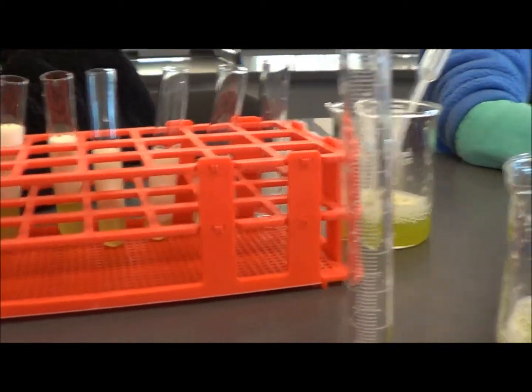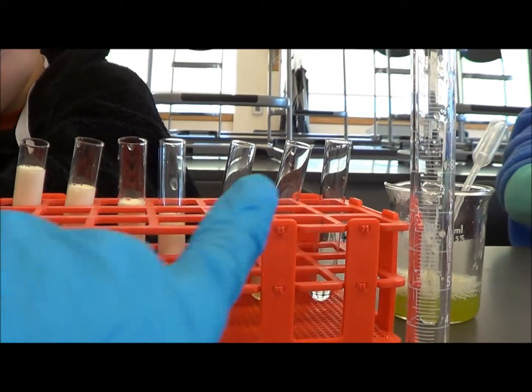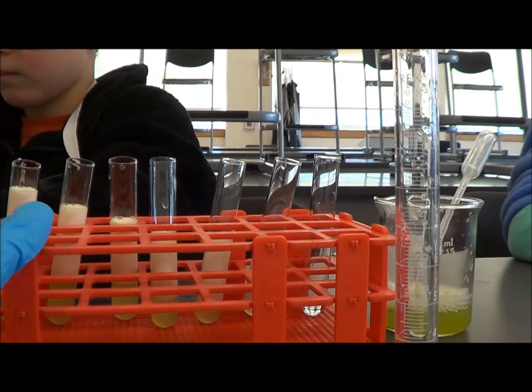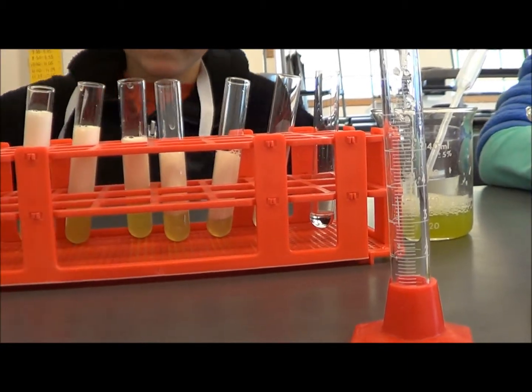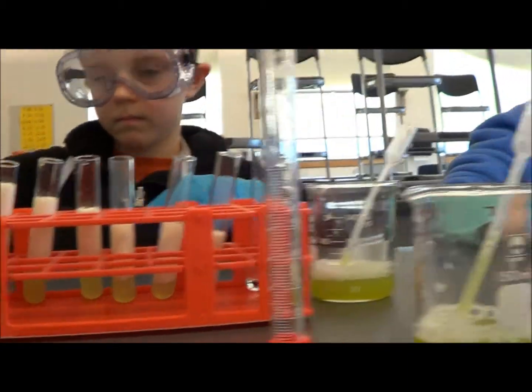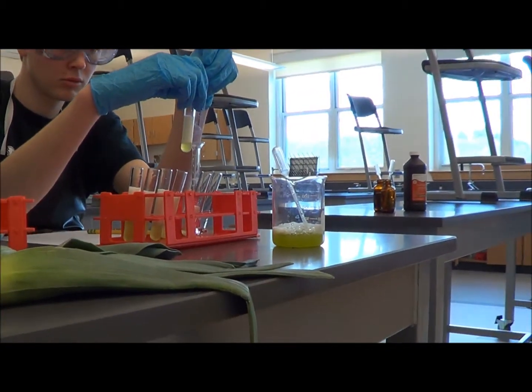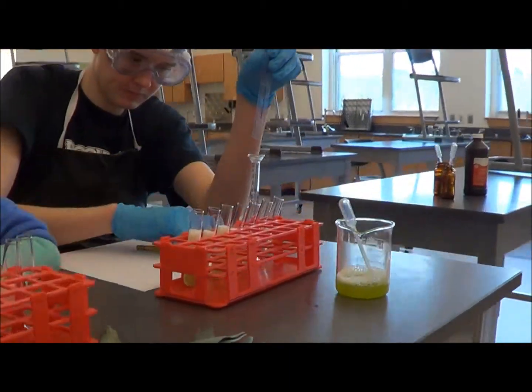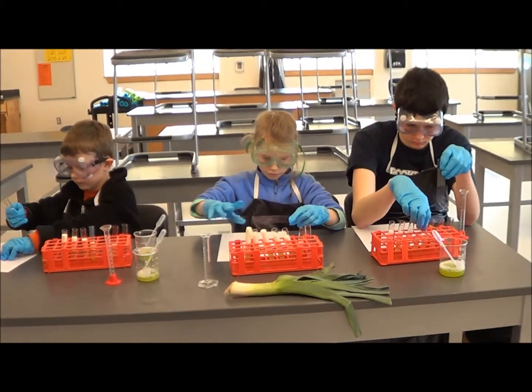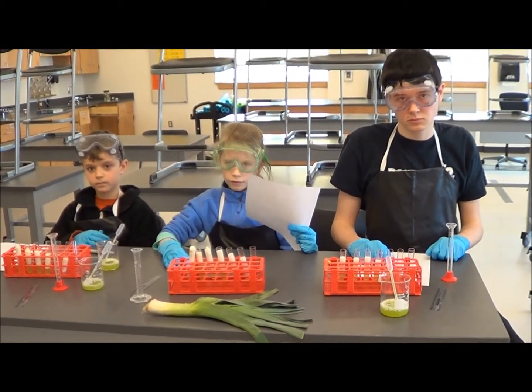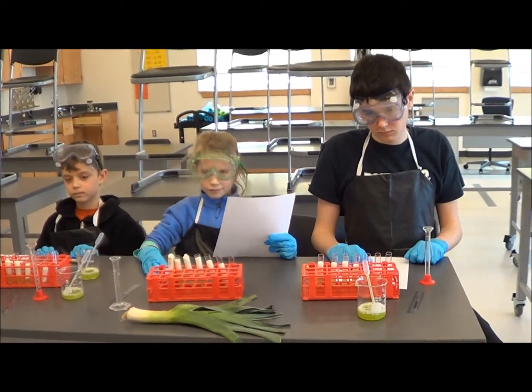You can even see that the bubbles - you're getting more and more bubbles as we go, but you have to be careful not to measure from the bottom. You have to measure just from the bubbles. This one's four, I'm moving on. Good, so you can write that down next. Then we'll put all the data together on the board. Nice work measuring, and now you guys can write it all on the board.